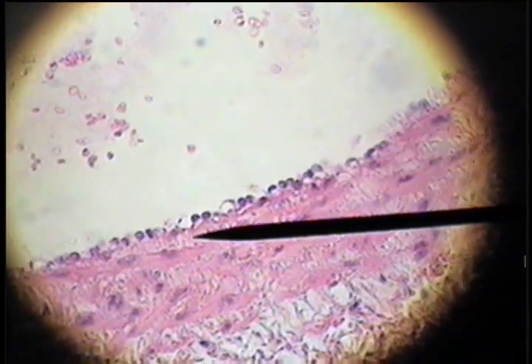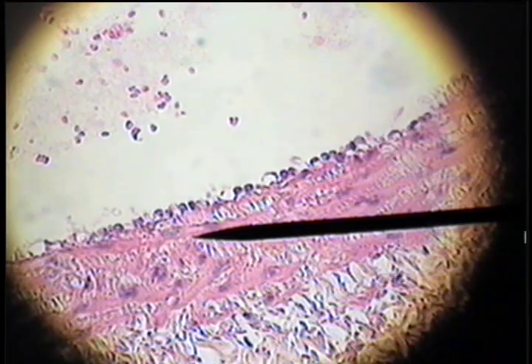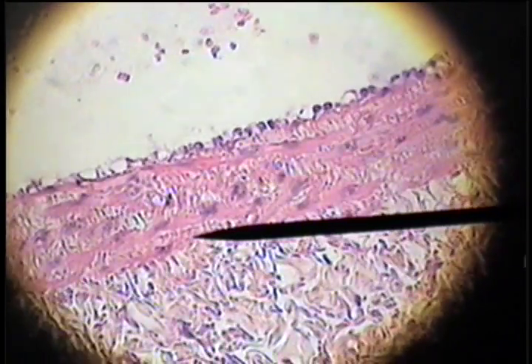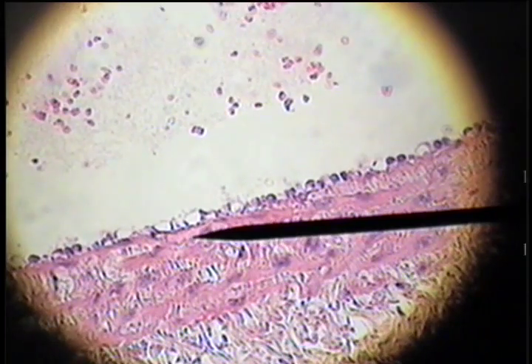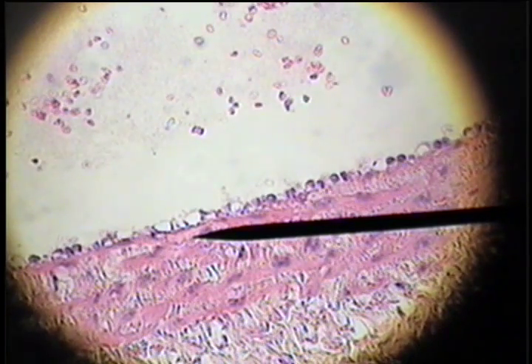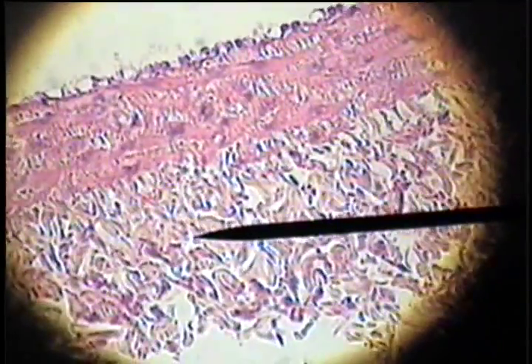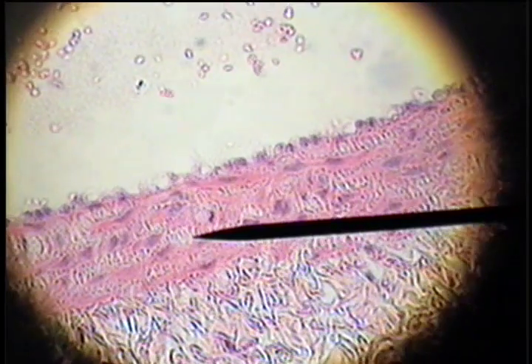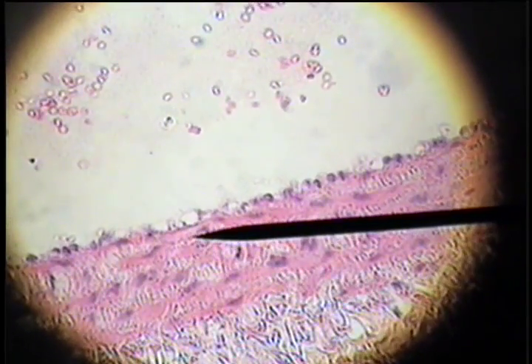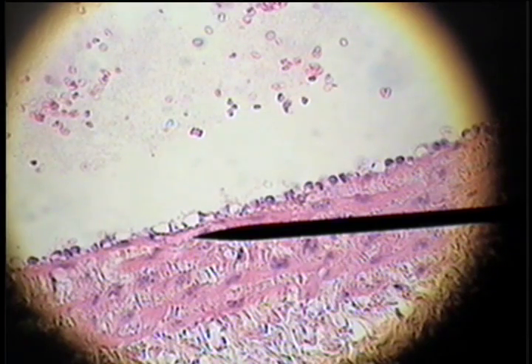there is this pink or eosinophilic line. And that's dense, elastic, collagenous connective tissue. That's the inner elastic membrane associated with this artery. And there's also some elastic tissue through the middle layer of this artery. This is dense, elastic connective tissue.